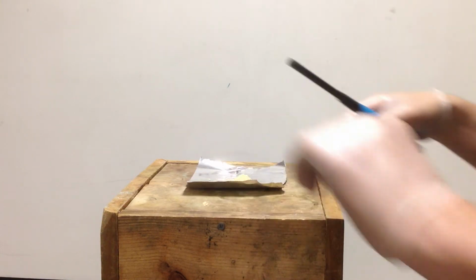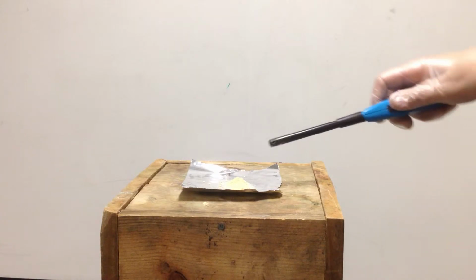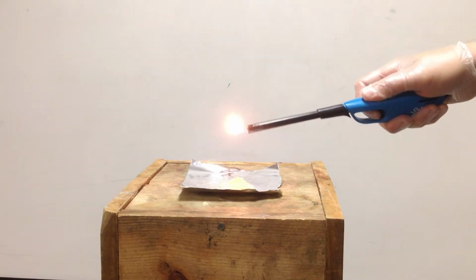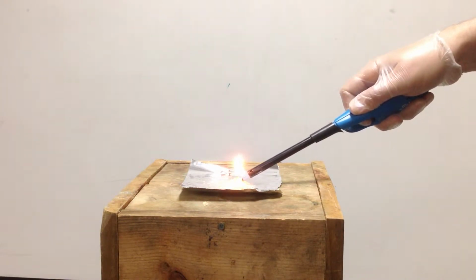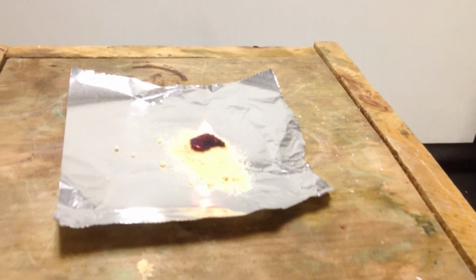And what's happening is the carbon in the cellulose is going to lose its electrons to the oxygen and make stable CO2 and water in this reaction. And we need some activation energy to start that, to overcome the activation barrier. And so when I light this and apply the activation energy, you can clearly see that a fire has begun, combustion has begun, okay, and that the cellulose, or the wood, is in fact burning.